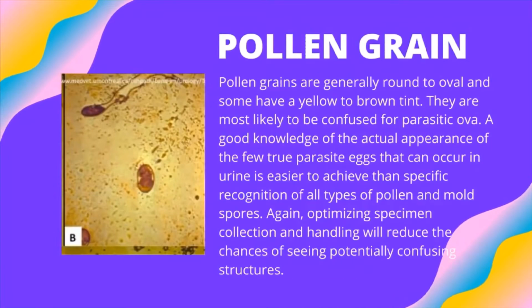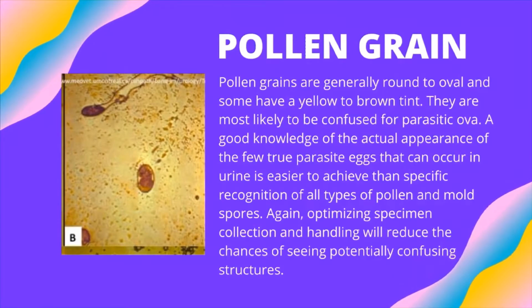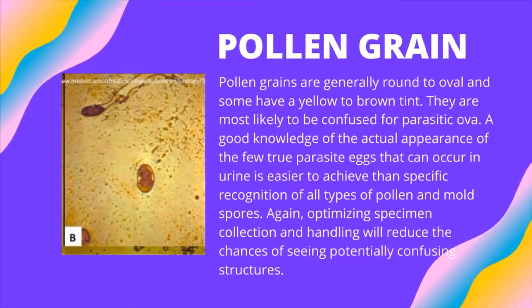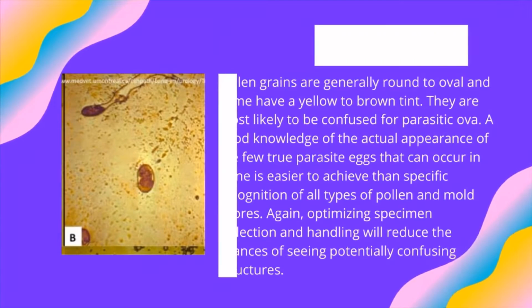Pollen grains are generally round to oval and some have a yellow-brown tint. They are most likely to be confused with parasitic ova. A good knowledge of the actual appearance of the few true parasite eggs that can occur in urine is easier to achieve than specific recognition of all types of pollen and mold spores. Again, optimizing specimen collection and handling will reduce the chances of seeing potentially confusing structures.